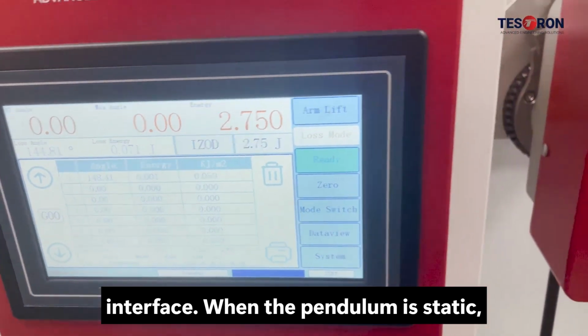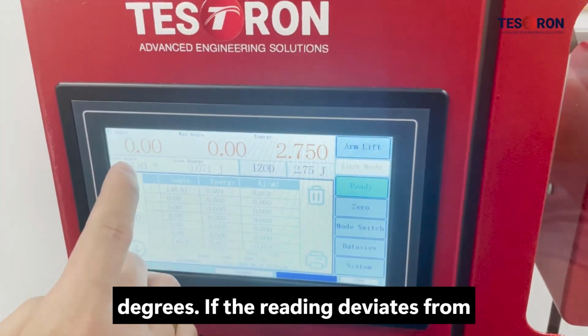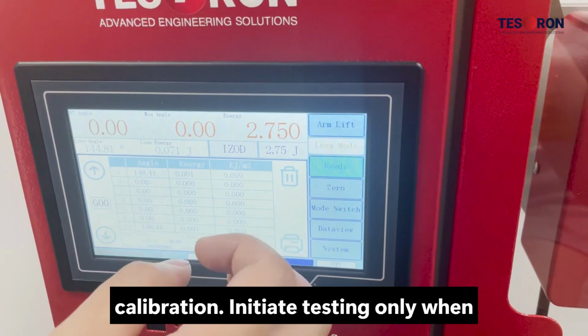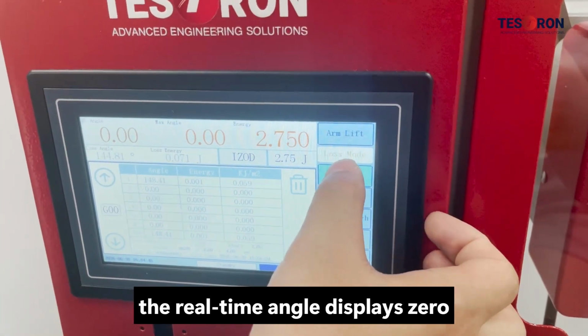When the pendulum is static, the RT angle reading shall show 0 degrees. If the reading deviates from 0, tap the 0 button to perform 0 calibration. Initiate testing only when the real-time angle displays 0 degrees.